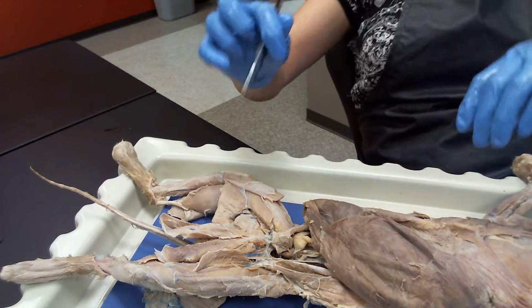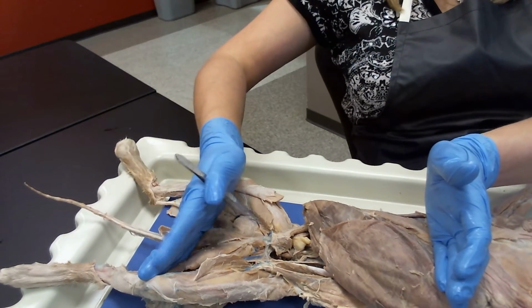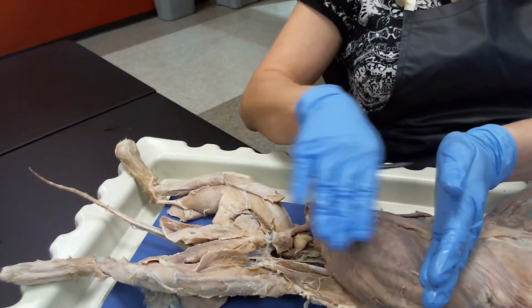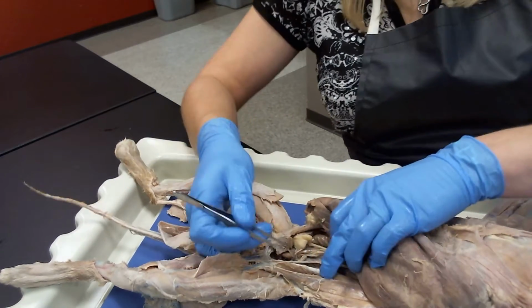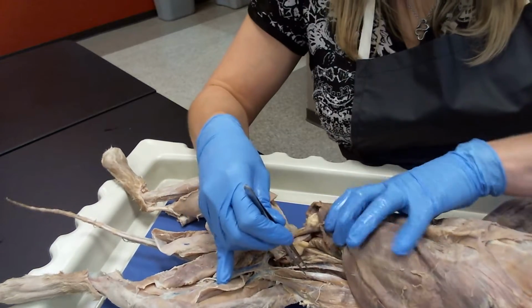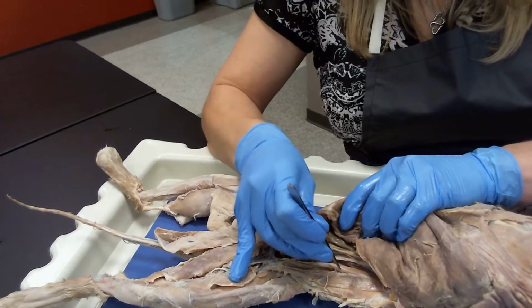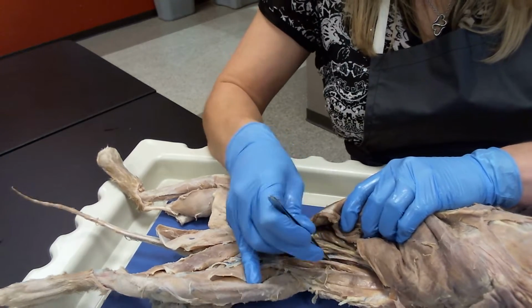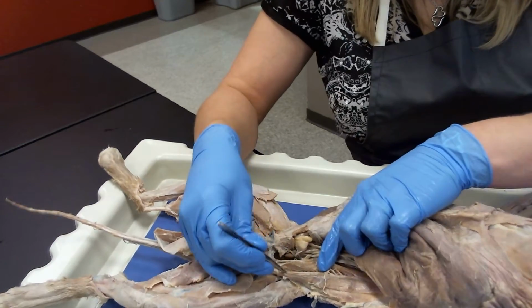All right, in this section, we're going to be looking at the nerves in the caudal half of the cat, all right? So we're going to start here looking ventrally, and then we're going to flip over and look at the dorsal aspect of the cat. Okay, so my first landmark nerve that I like for you guys to know in the ventral aspect of the cat is going to be right here in your psoas major, psoas minor, iliacus region. And this particular nerve is your femoral nerve.